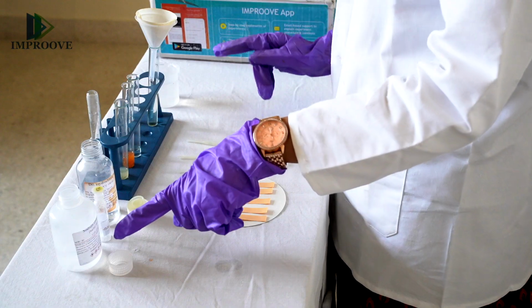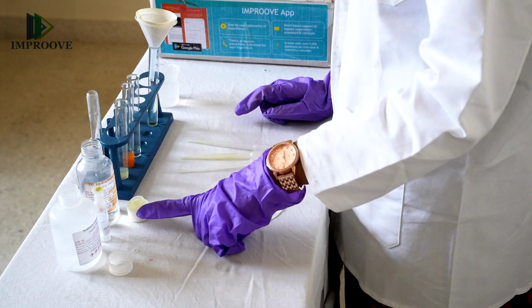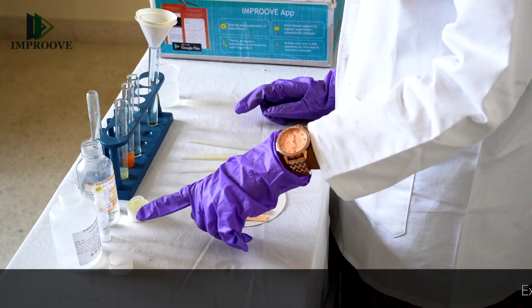In this experiment, we will be studying and testing the pH of various solutions. For the experiment, you will need 5 different types of solutions. You can take sodium hydroxide for a dilute base solution. You can take dilute hydrochloric acid. You will need sodium chloride, which you will dissolve in about 10 ml of water, and that will act as your salt solution. You will need a sample of a fruit juice.